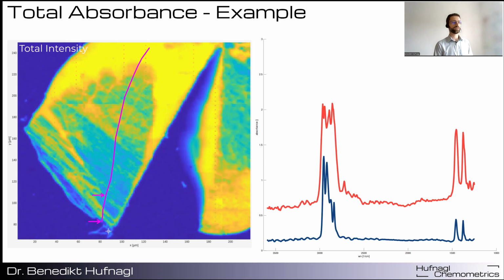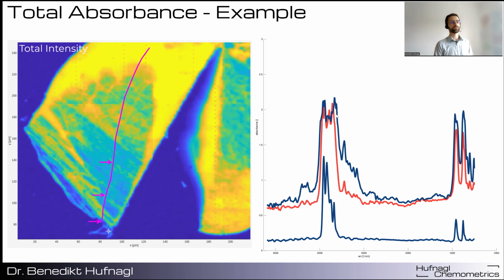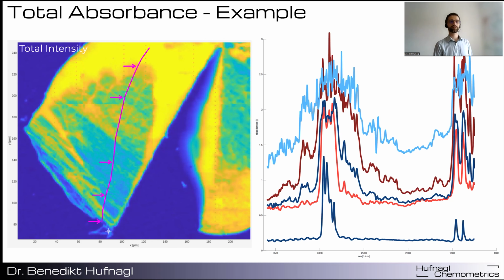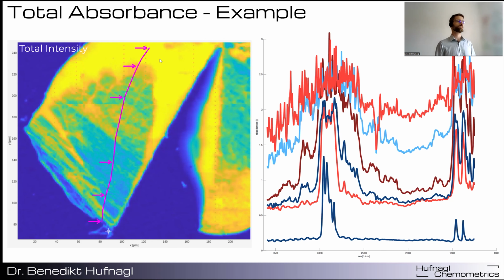These are still complete. And here the situation gets worse. But on the other hand, we get new peaks which can be used for classification. Here almost all data is lost. Here still something is left that we can use for classification, and here we only see noise. Now the question is, can machine learning still deal with this kind of data?